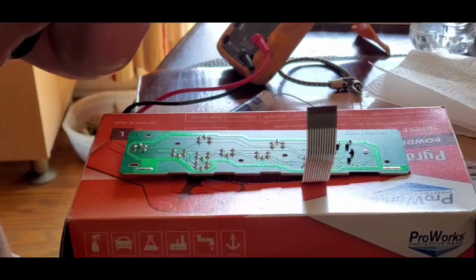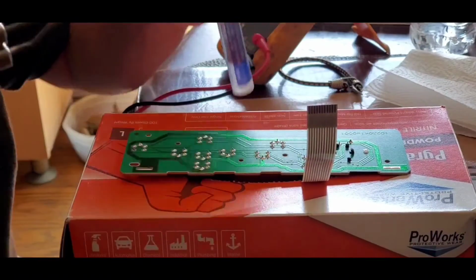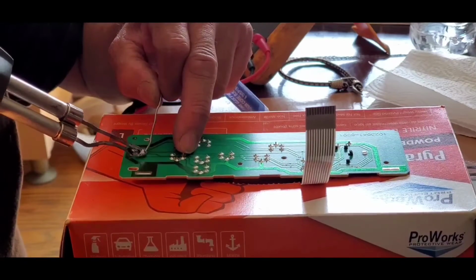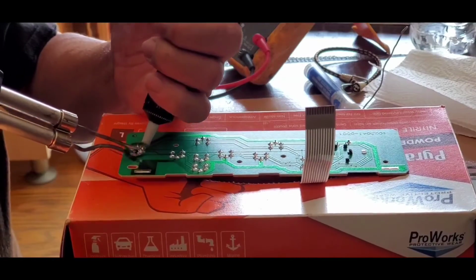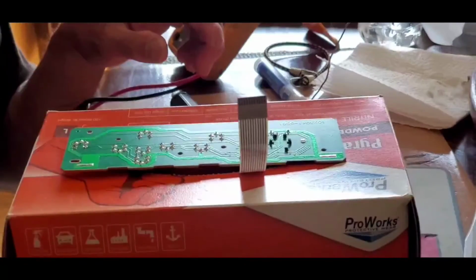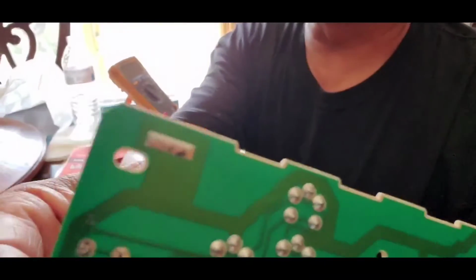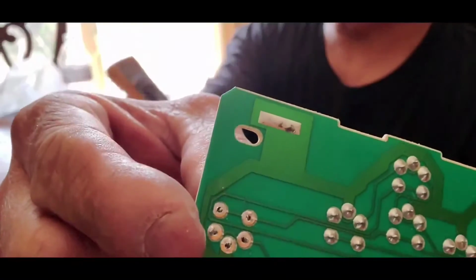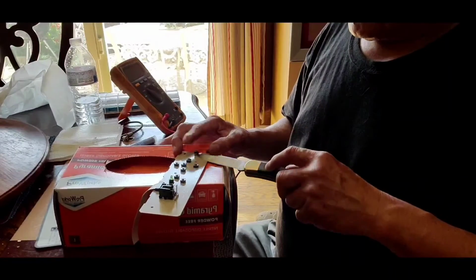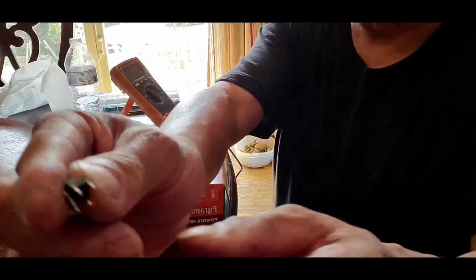Next, we'll do the same process. Heat it up. Apply fresh solder on it to melt the existing one, and then suck it. And let's do it over and over again. Okay, I got all the solder off of the switch. This switch here. So I'm gonna take it off now. Using a knife, just put it underneath and pry it up. There you go. There's the switch. See?